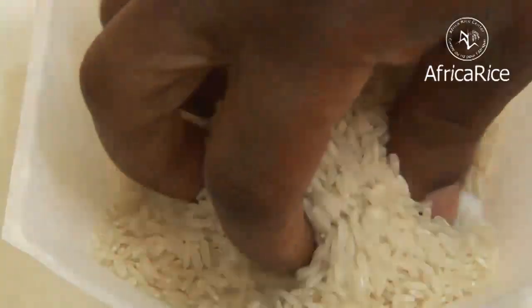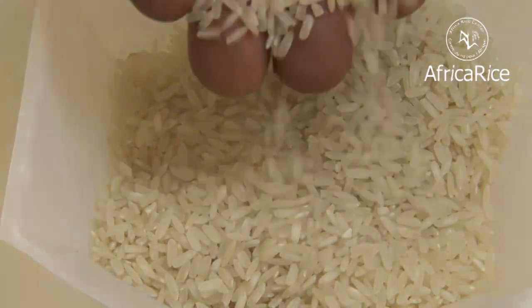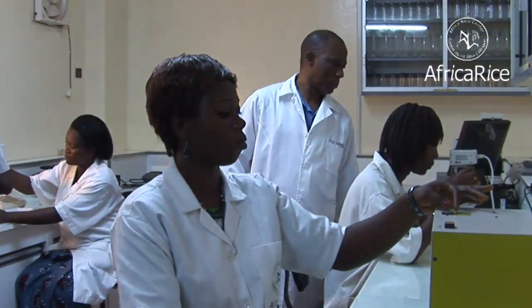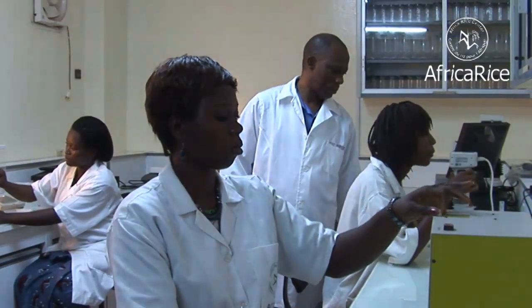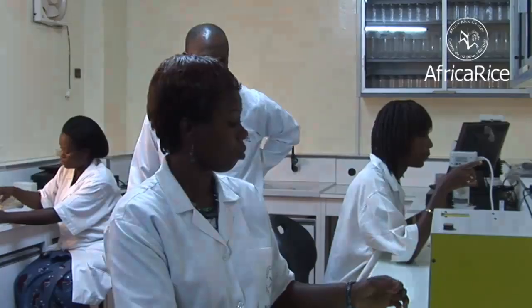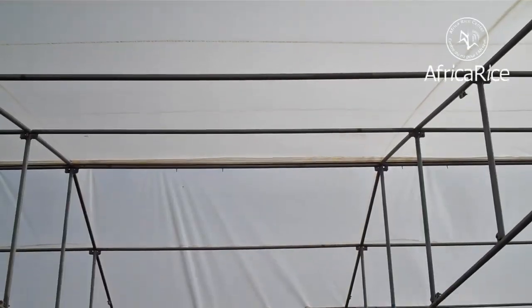Rice grain quality has two main dimensions: physical quality and cooking properties. At Africa Rice, these aspects are determined in its Grain Quality Lab, and the information is passed on to the plant breeders.